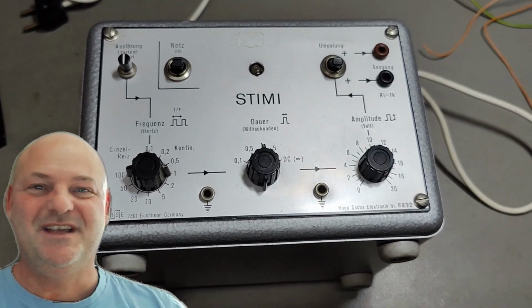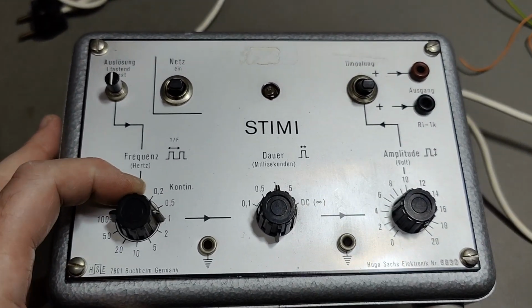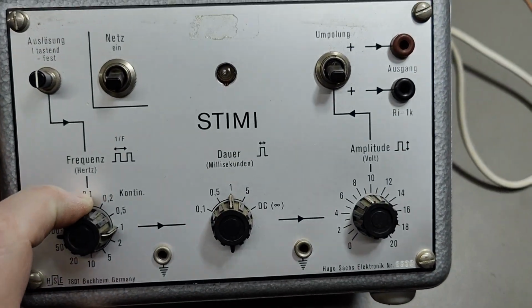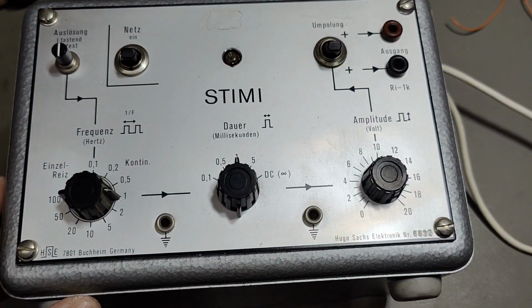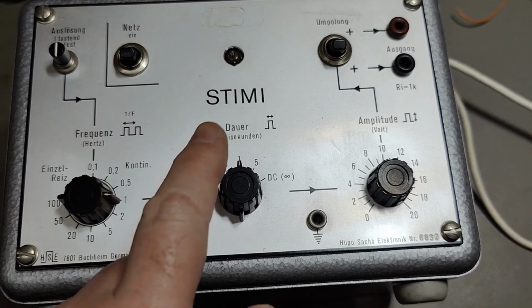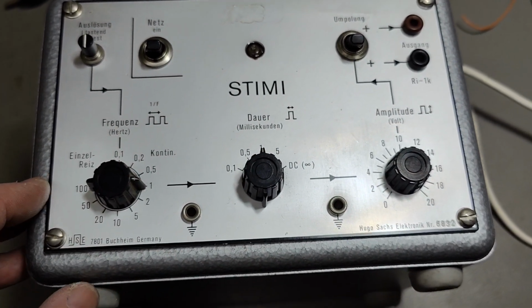Welcome to a new test and teardown video. This time, it's an old signal generator or something like that. It's called STIMI. So I think that is for stimulator. I mean, it must be something like that, right?